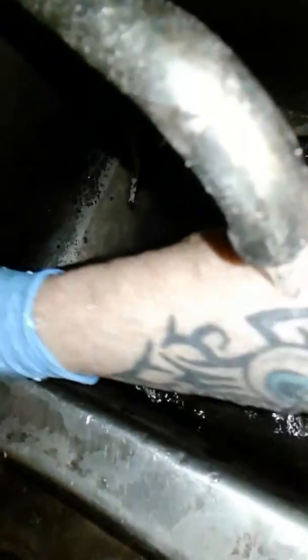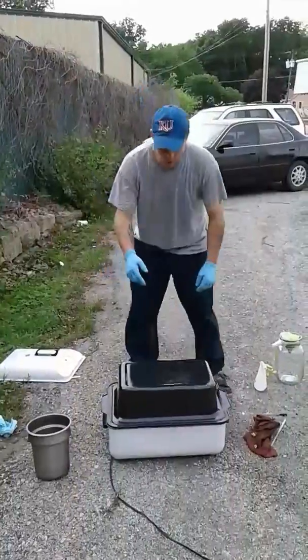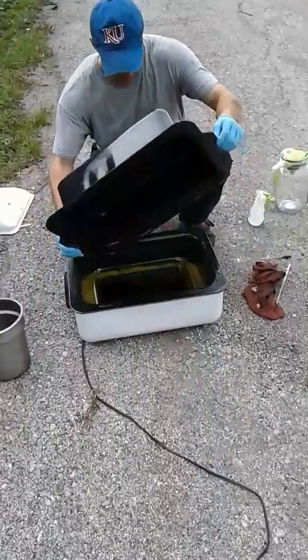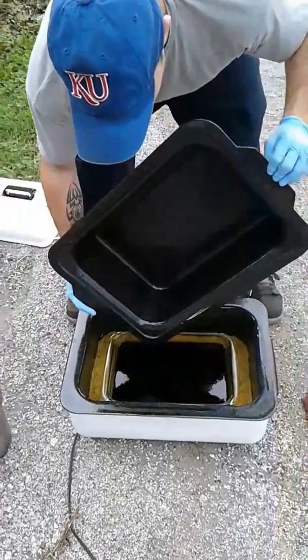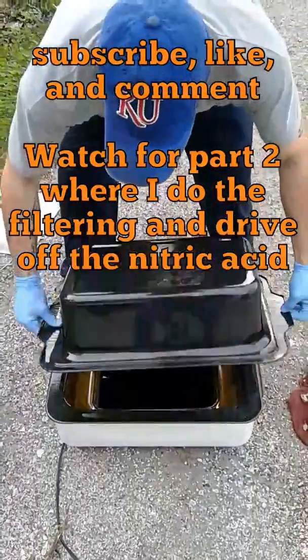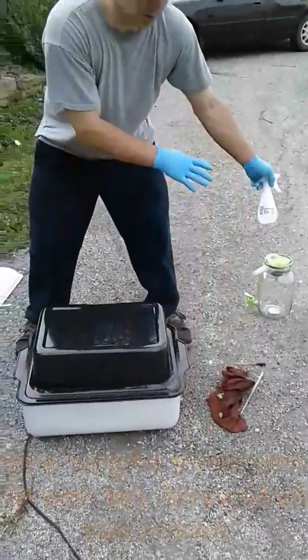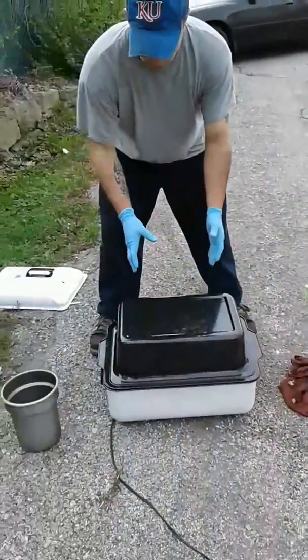I've done my dissolving and I put this lid on to protect it, but there's yellow liquid on both sides that I want to keep because there's going to be precious metals in there. I have my assistant here to help me video it, but I'm going to be funneling it. I have distilled water — you don't want to use tap water because there are all sorts of different types of metals in tap water that will interfere with your precious metals.